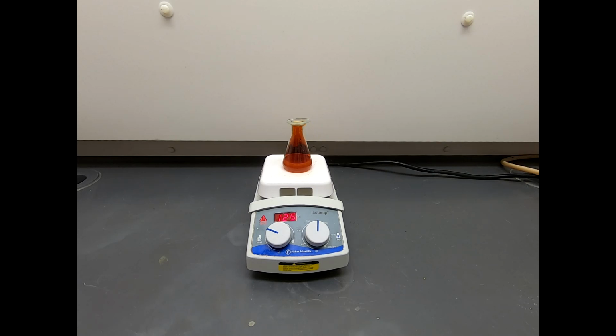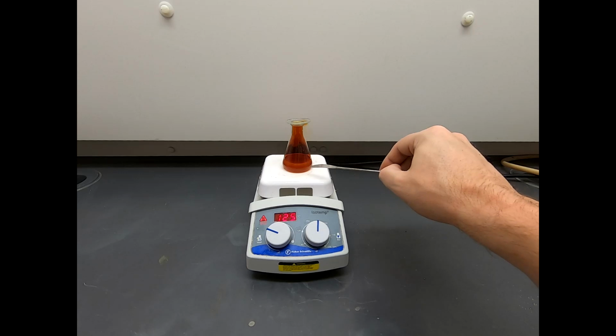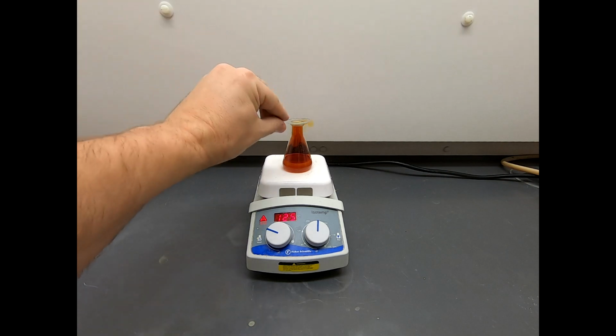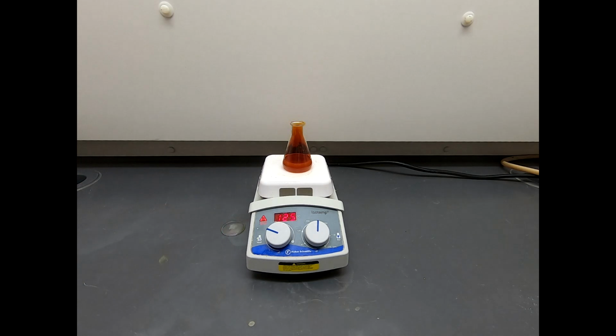Well, what a difference just a few minutes makes. It's about 10 minutes later, and as you can see, this whole thing is extremely dark with this brown vapor. After probably 2 minutes, it was almost a yellow color in here and still looked white at the bottom. But now we've generated a lot of this vapor, and it's gotten super dark. And you see, I'm capping it. We can let that open up. And these are nitrogen oxides that get formed from the reactions that involve nitric acid.